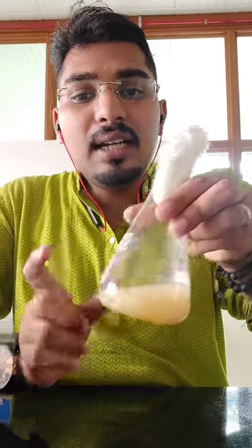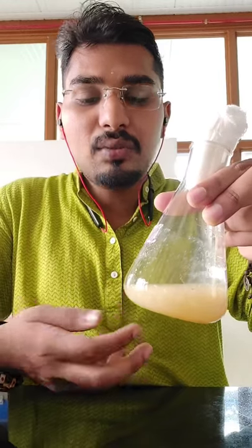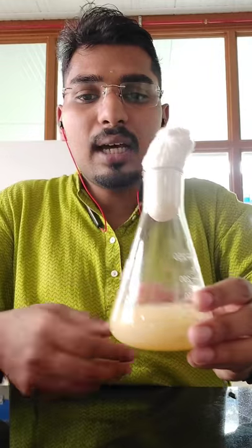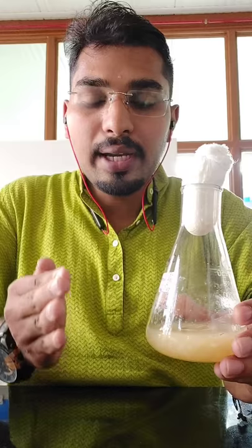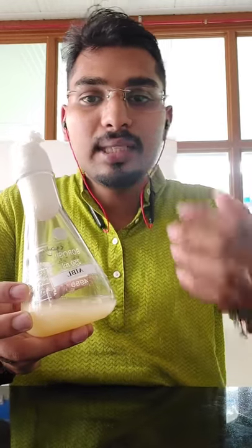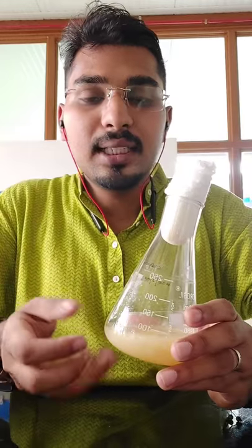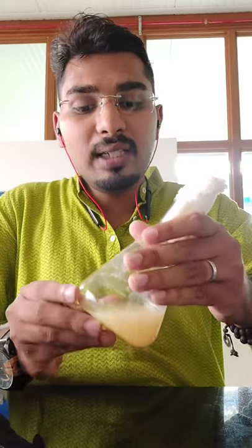For that you need to have a fungal growth. We will inoculate the fungus in suitable media like potato dextrose media or rose bengal media, whichever your fungal organism grows in. You will leave it around 2 to 3 days depending on the fungal organism and how much time it requires for its luxuriant growth — usually at 25 to 27 degrees Celsius for fungi.